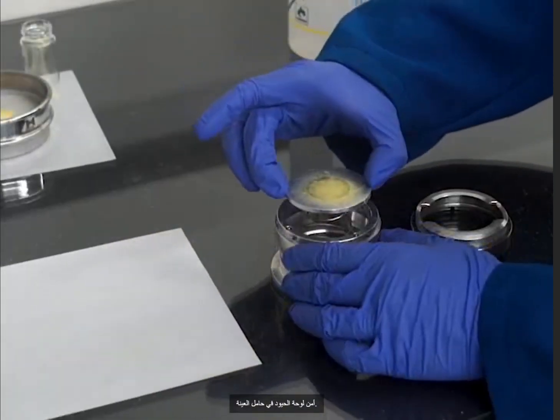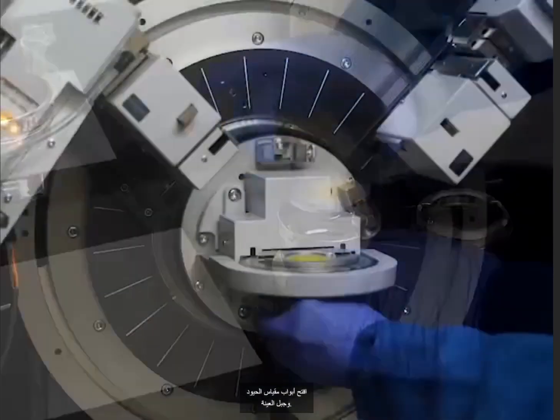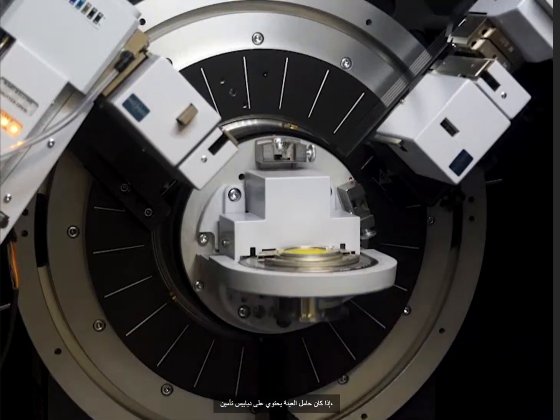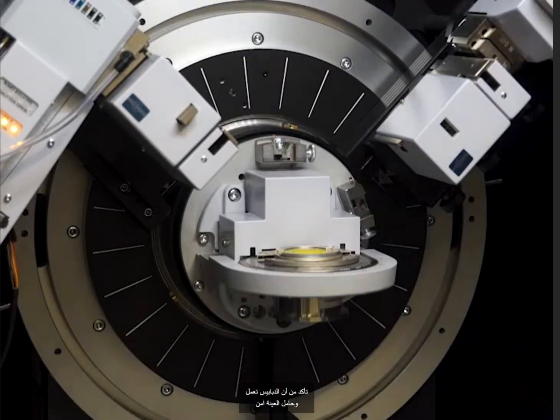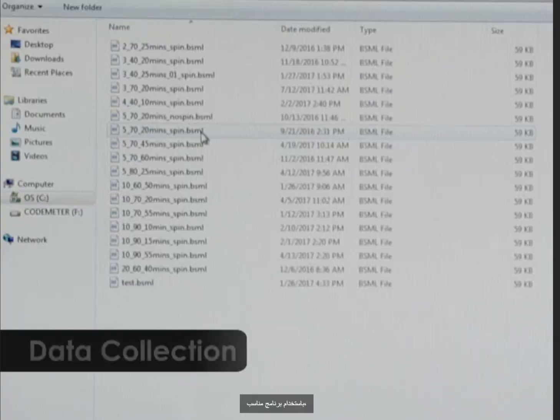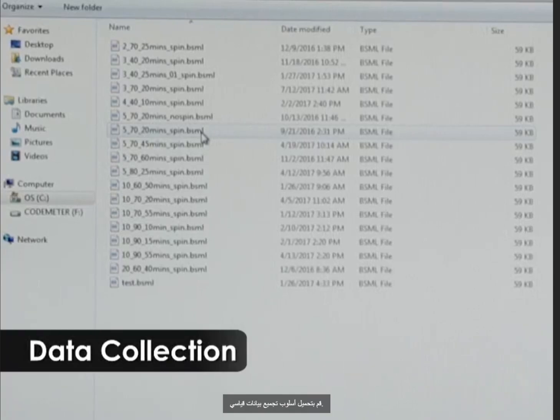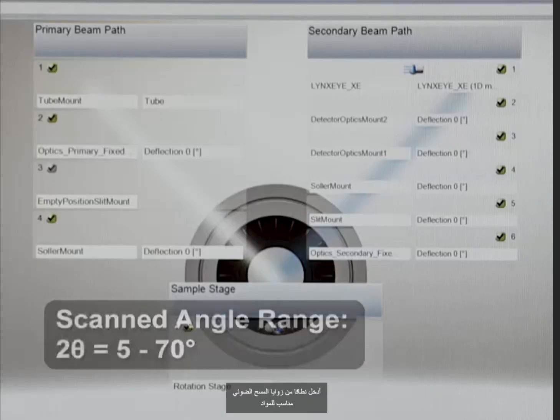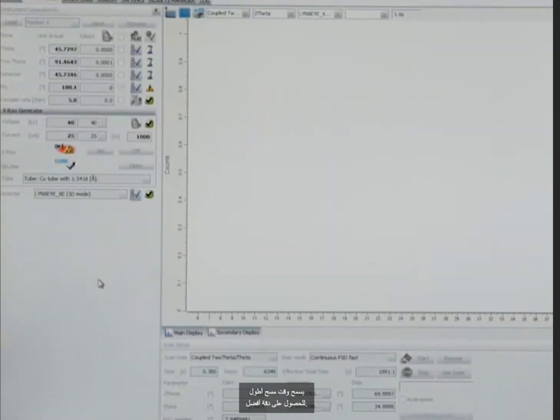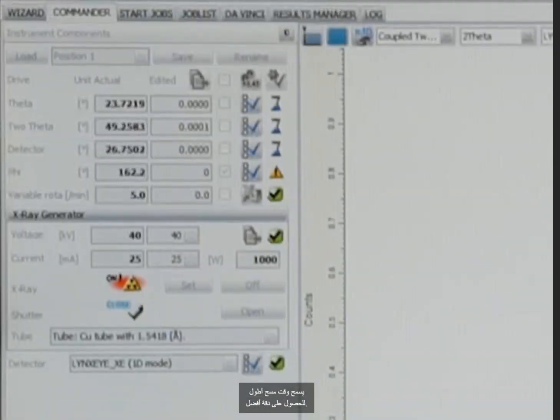Secure the diffraction plate in the sample holder. Open the diffractometer doors and mount the sample. If the sample mount has locking pins, ensure the pins are engaged and the sample holder is secure before closing the doors. Using a suitable software, load a standard data collection method. Enter a range of scan angles suitable for the material. Then enter the scan time. A longer scan time allows for better resolution. Then press Start.